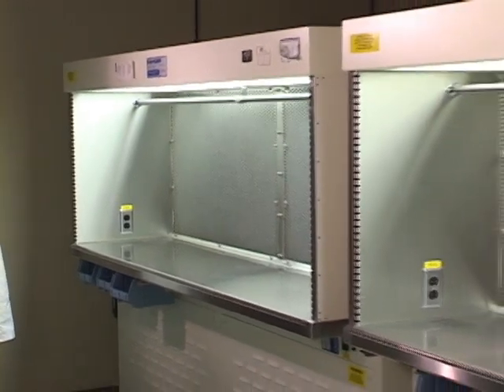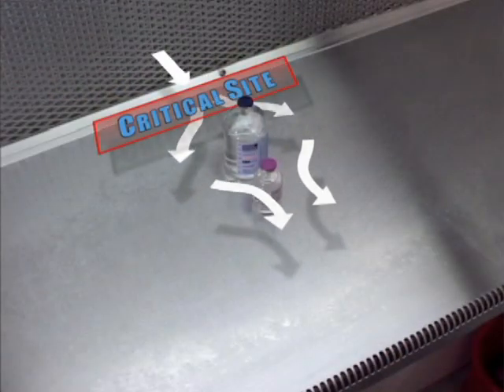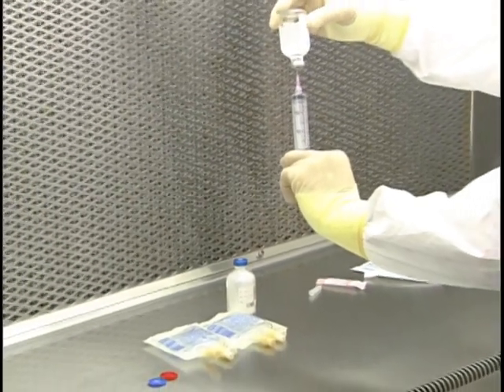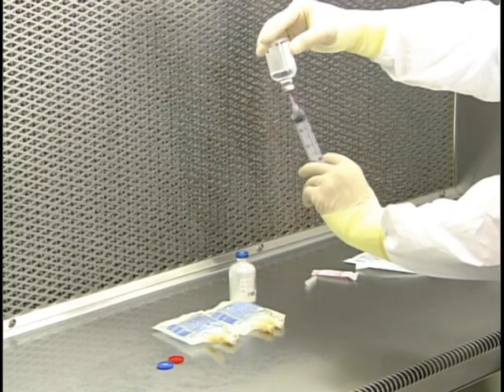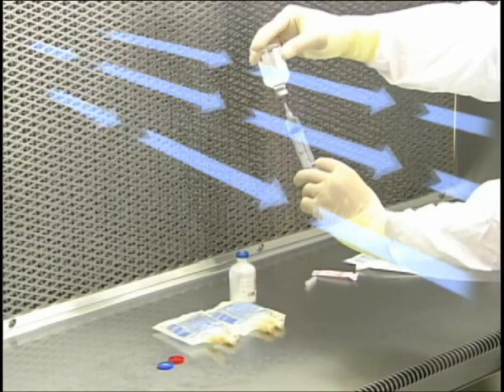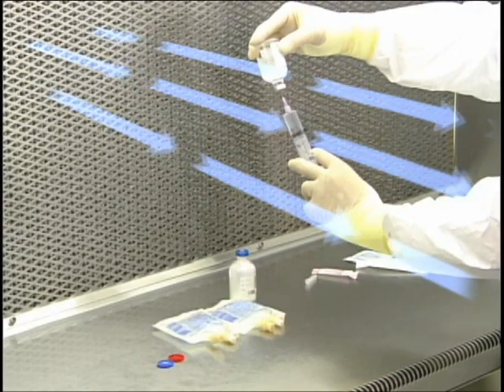Within a laminar airflow workbench, the space between the HEPA filter and the sterile object is known as the critical area or critical site. First air is HEPA-filtered air that washes over the component in the compounding work area. Because the air downstream from non-sterile objects may become contaminated with particles, a direct path of first air between the HEPA filter and the critical work area inside the hood must be maintained. Your hands should never enter first air or obstruct airflow around the area where the needle enters a vial or ampule.